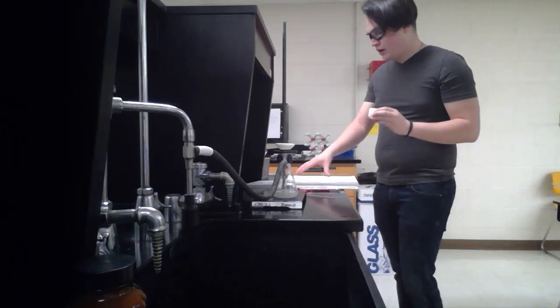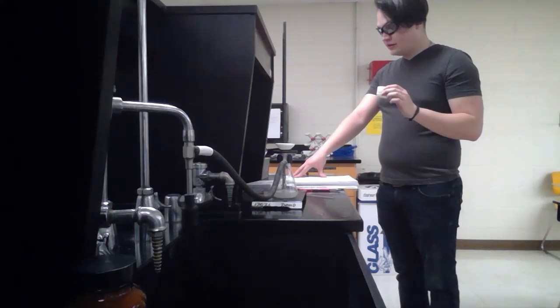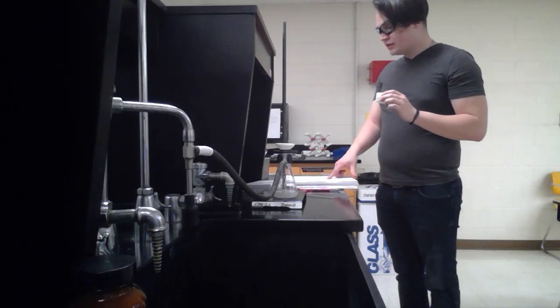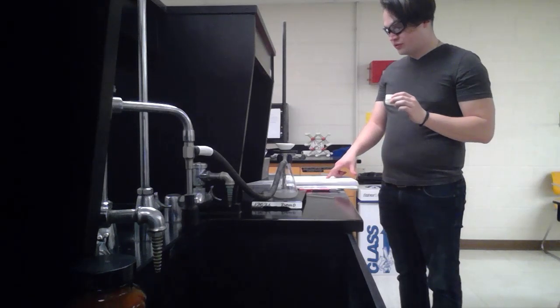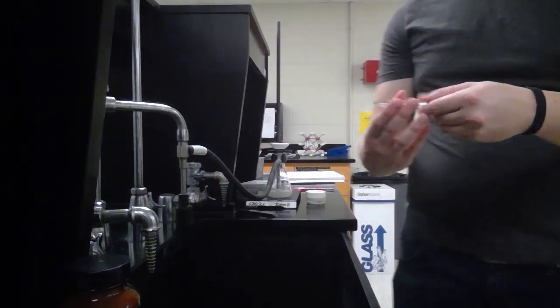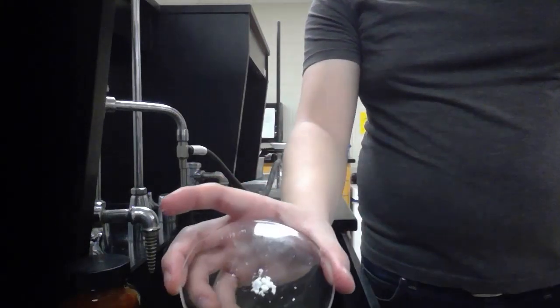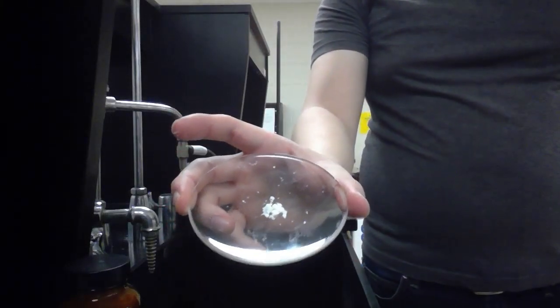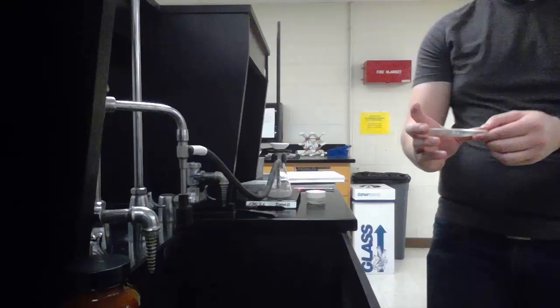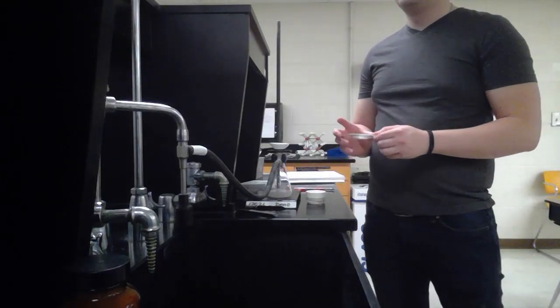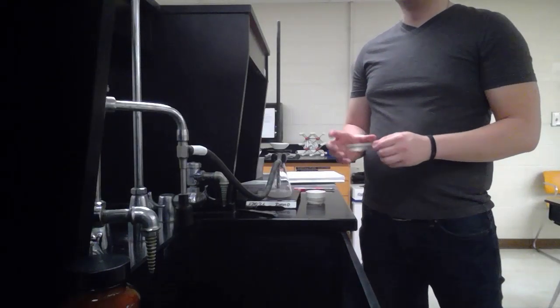We weighed the Buchner funnel for the second time after drying. That mass came out to be 18.26 grams. So we isolated some of the product onto a watch glass, and this is what we're going to be doing the TLC and ferric chloride and the litmus paper test on.